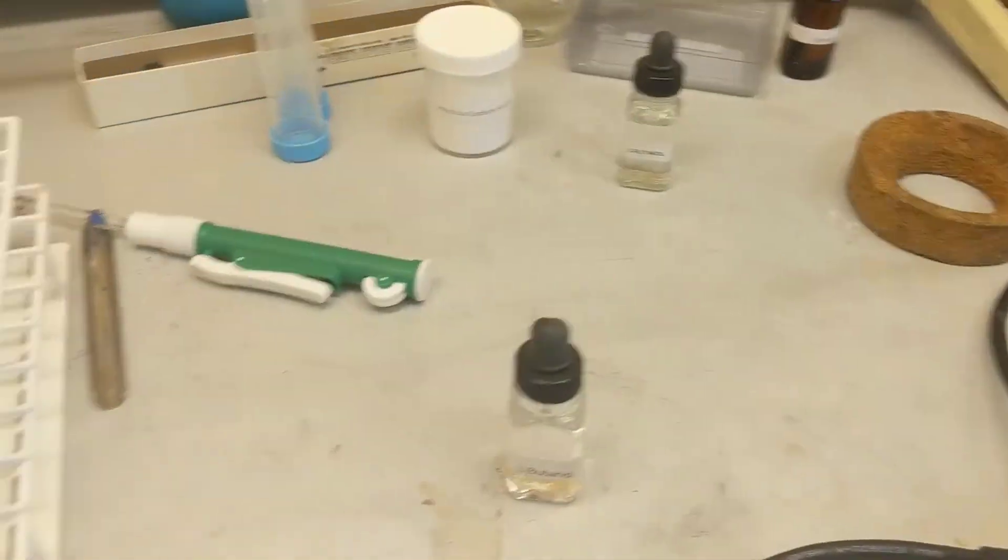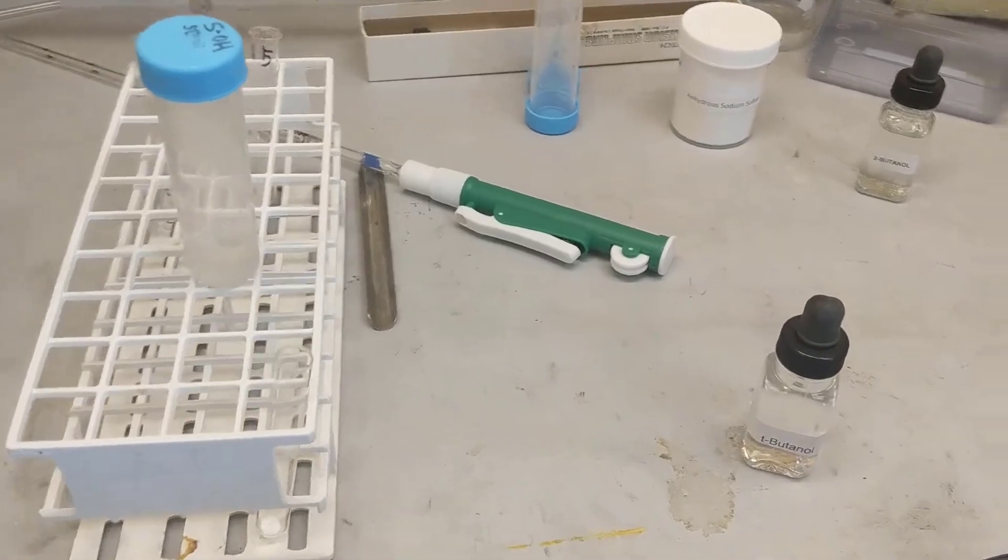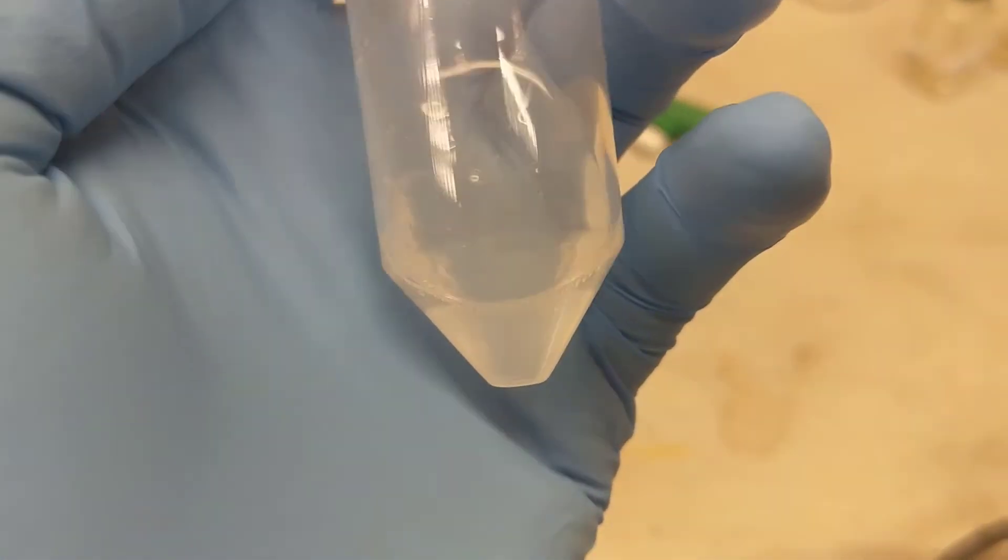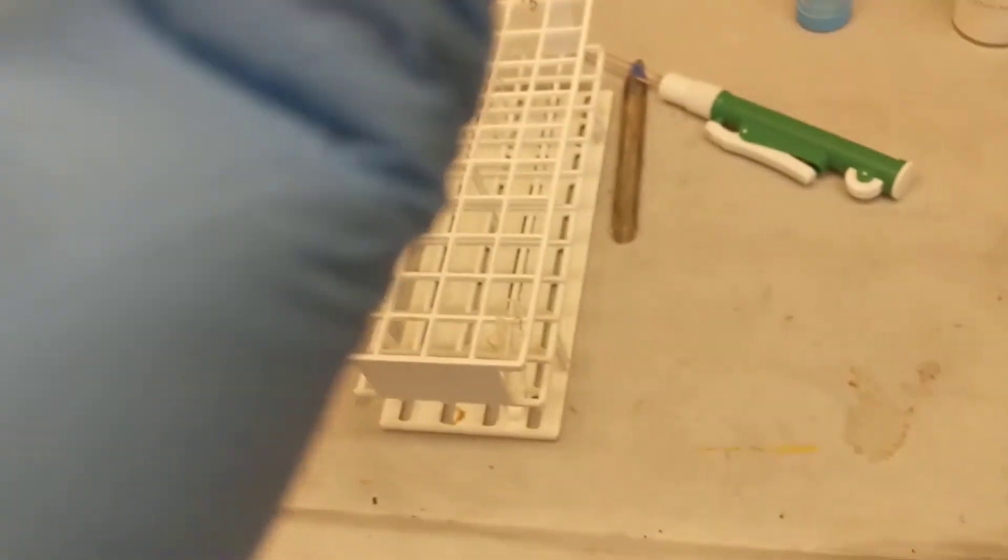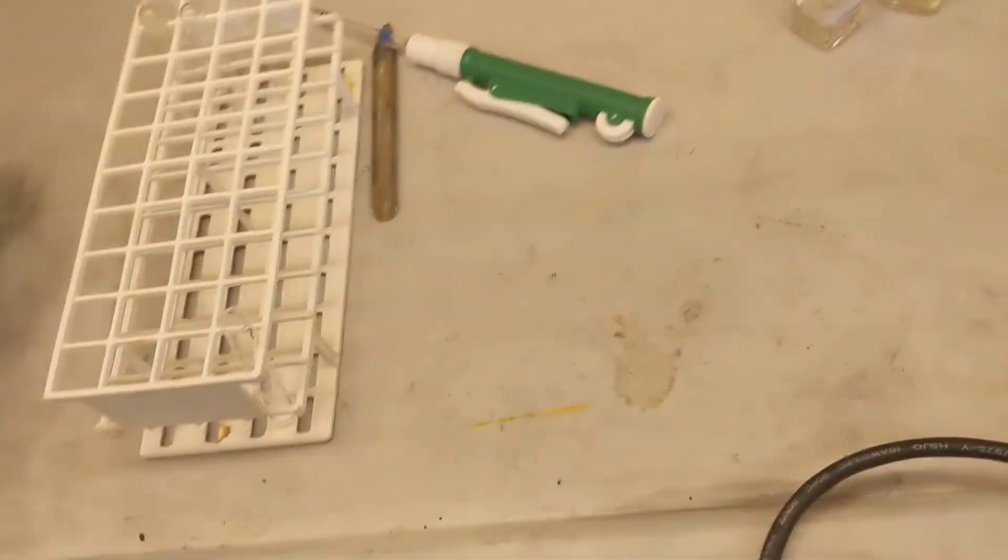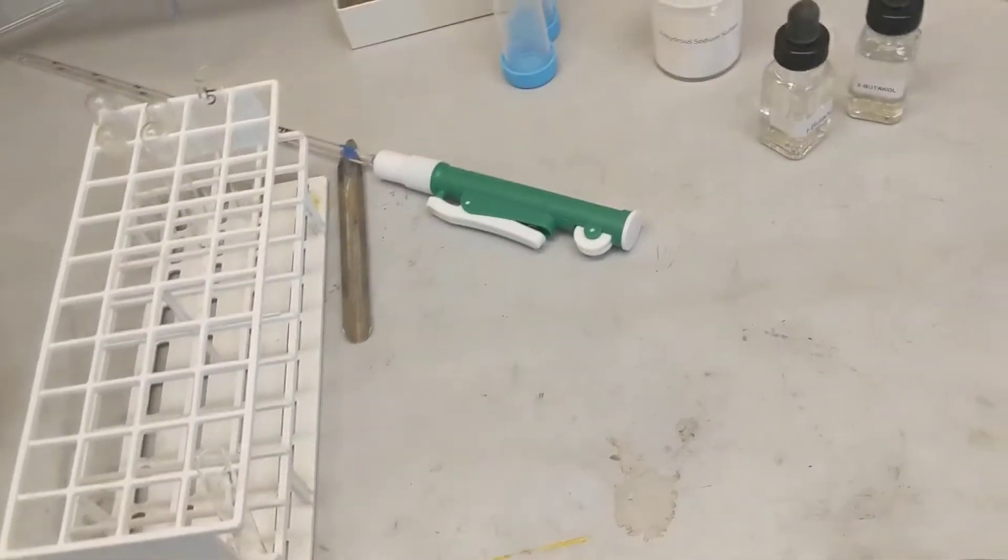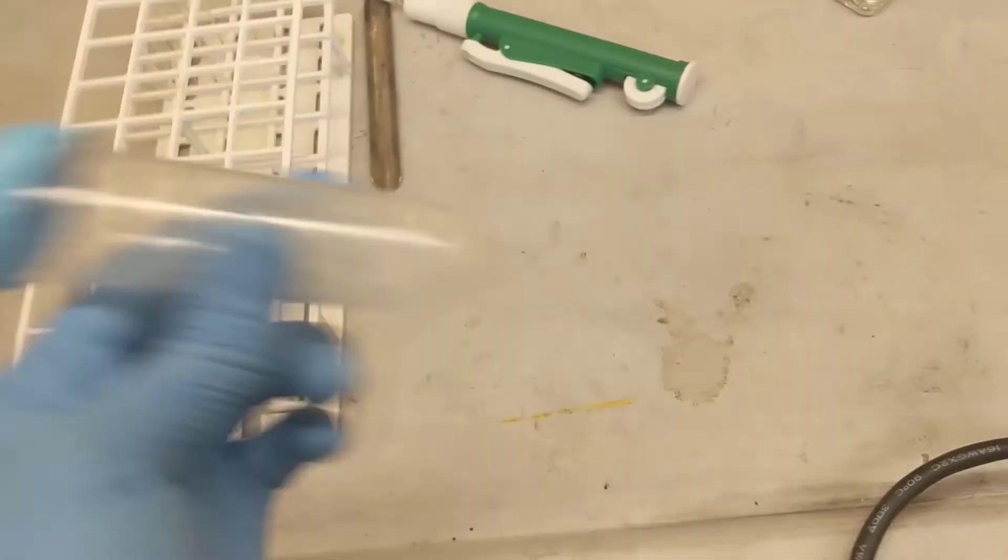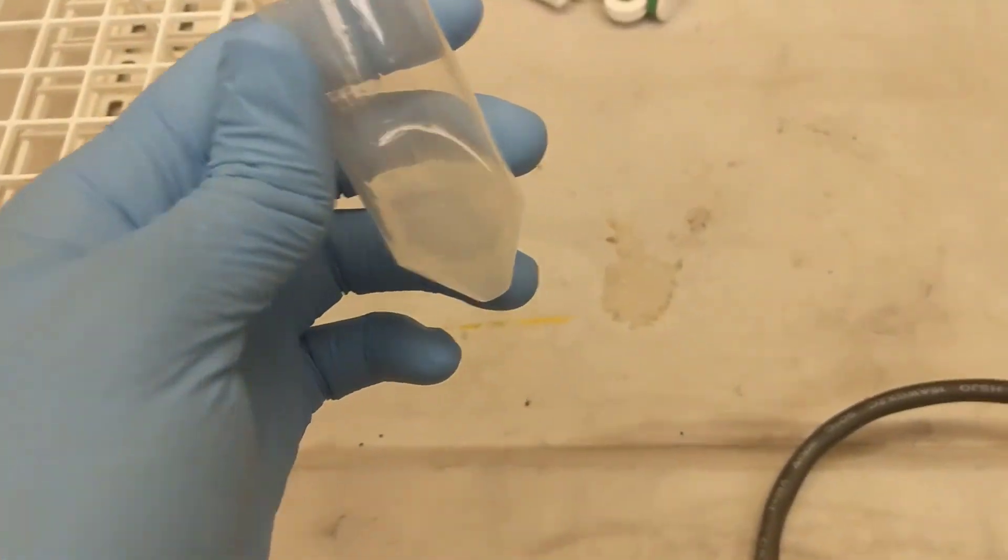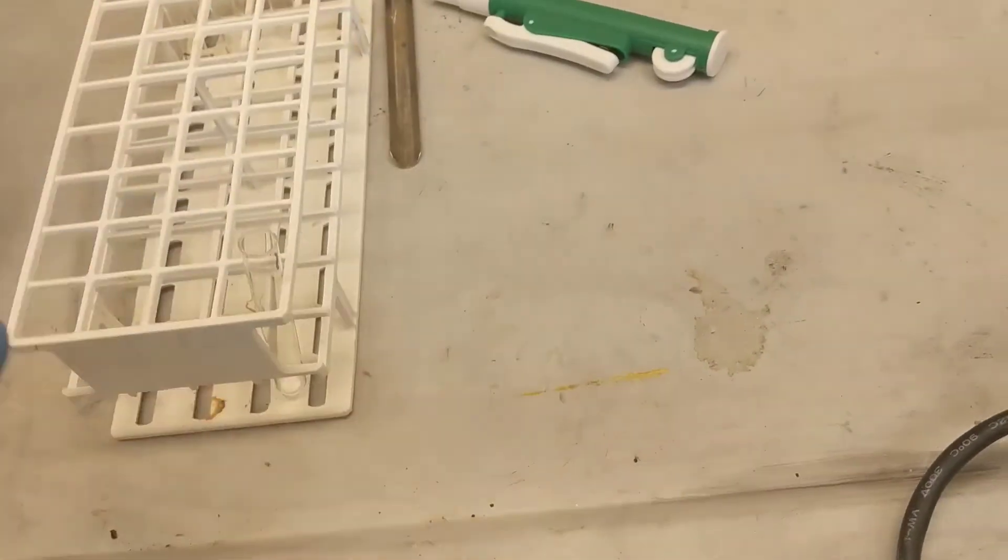Experiment 20B - just got this out. I don't know if you can see, there's just a little bit of salt down at the bottom, so I'm going to go ahead and add 1 milliliter of tert-butanol. I added my tert-butanol and I'm just shaking this up. You can see how cloudy it's getting. I think I'm dissolving all of the salts here. Let's see if we can get a close-up. Looks pretty clear. When I look at it very closely, I can see tiny little particles. I'm just going to shake until it's all dissolved, about five minutes. Let my layers separate out and then take out my aqueous.